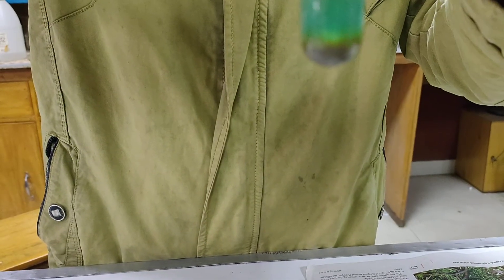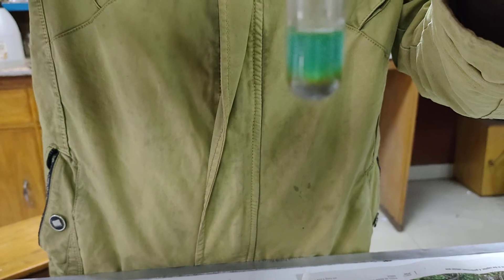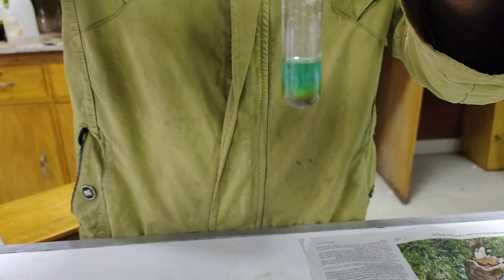This brown coloration is the presence of iodine. So the copper ion has been tested in 4 ways, confirming the presence of copper.